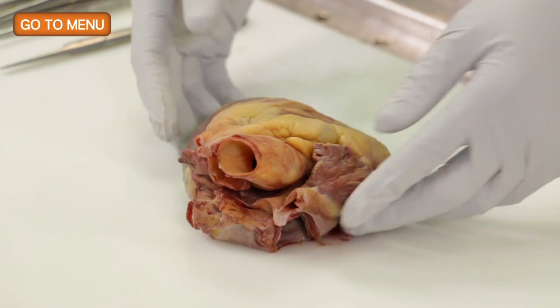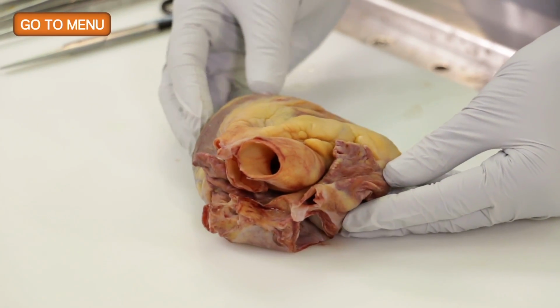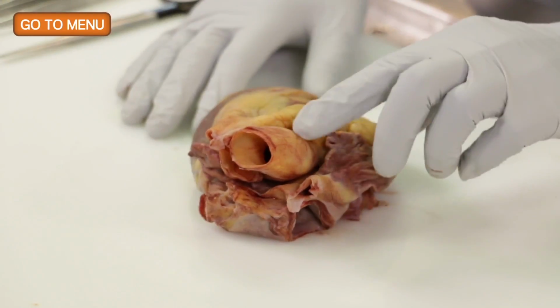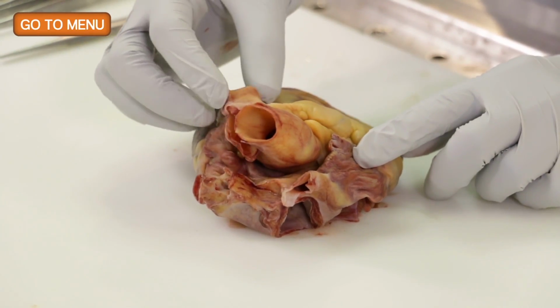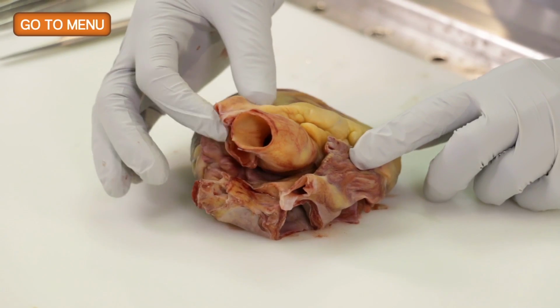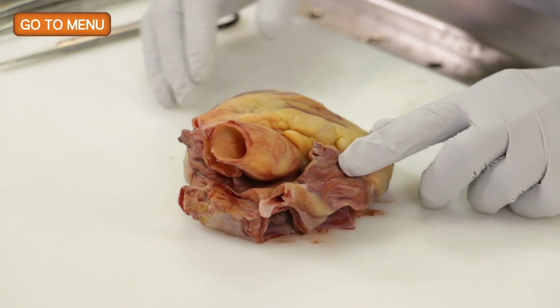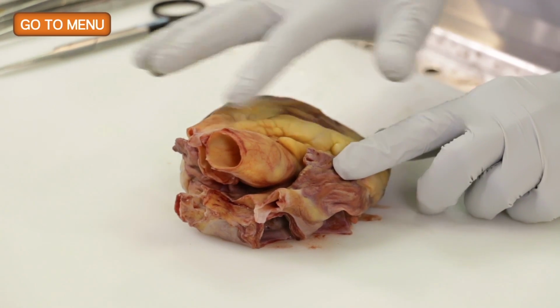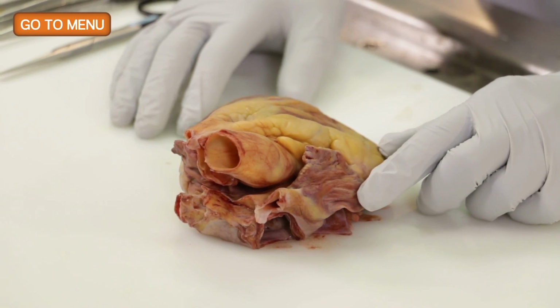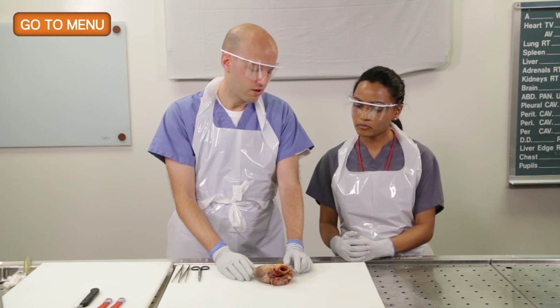So we're looking at the front of the heart here, and as I mentioned, we have the aorta and the pulmonary artery. The pulmonary artery, of course, has been cut off from the rest of the pulmonary artery, but in situ, we usually make a nick in the pulmonary artery, which is the rightmost trunk, and we do that for what reason?